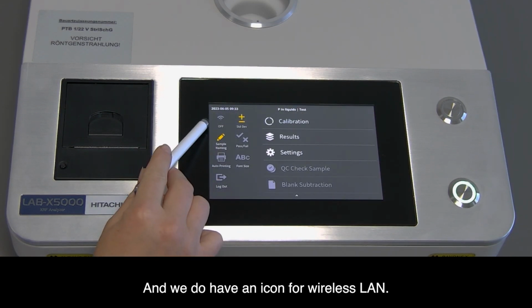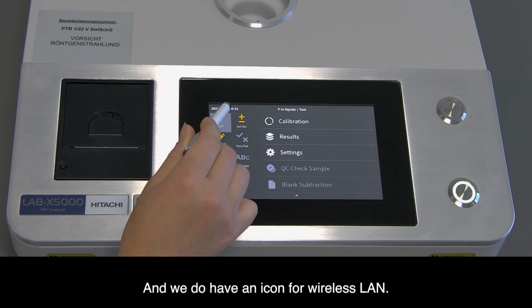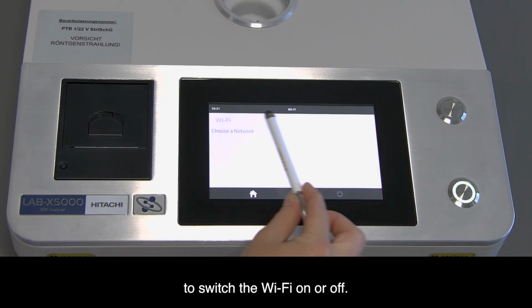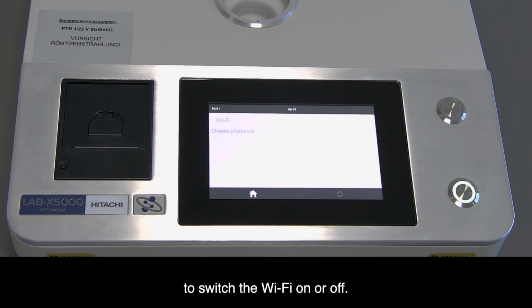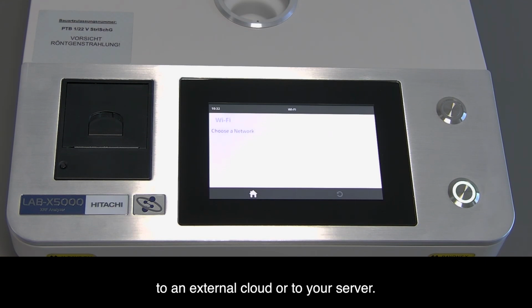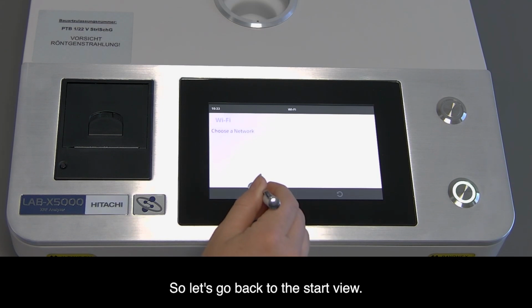And we do have an icon for wireless LAN. So we have the possibility to switch the Wi-Fi on or off. When the Wi-Fi is enabled, you have the possibility to send your results directly to an external cloud or to your server. So let's go back to the start view.